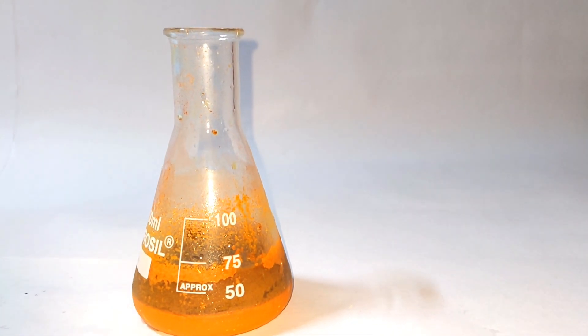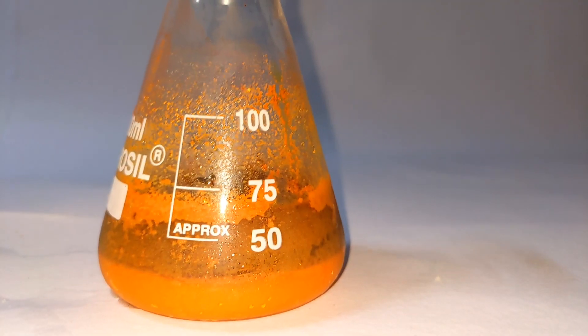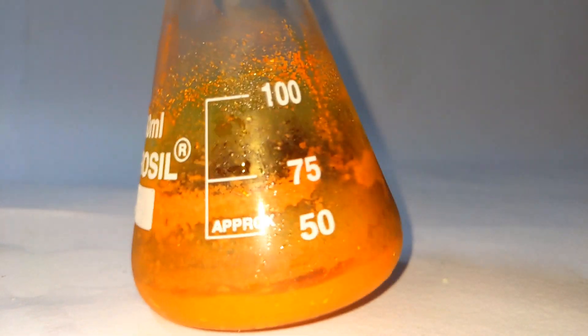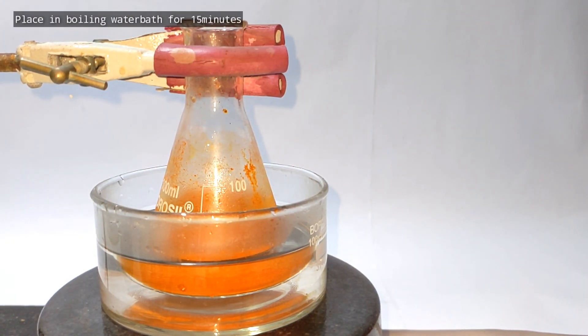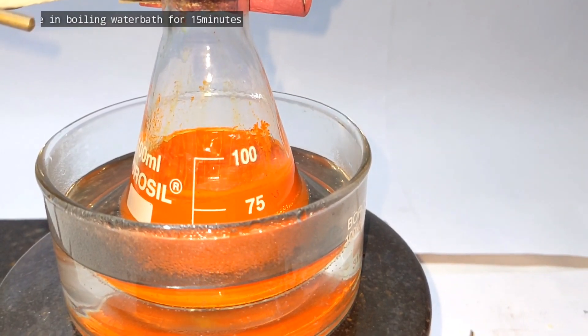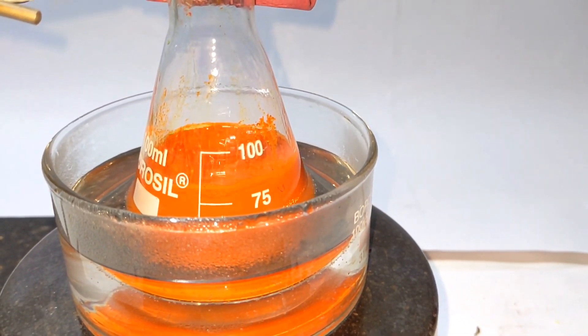The complete addition took me about 15 minutes and this is what I got finally. Now the flask is placed in a boiling water bath with 10 milliliters of extra ethyl alcohol for about 15 minutes to digest the product.